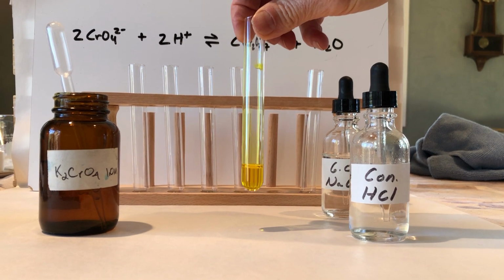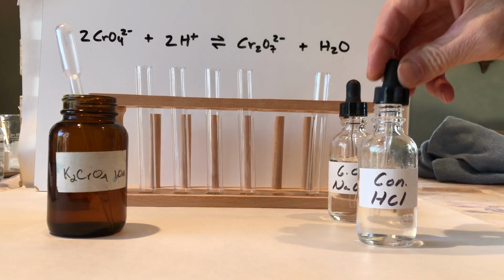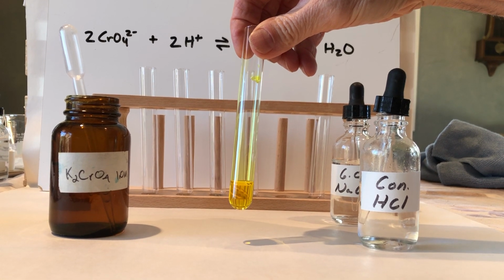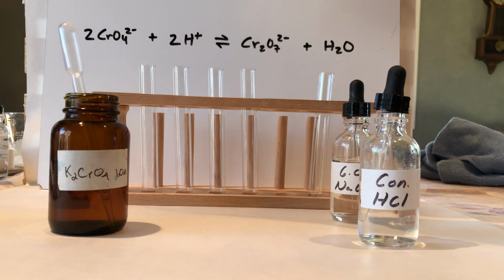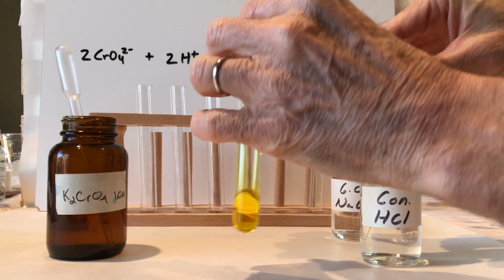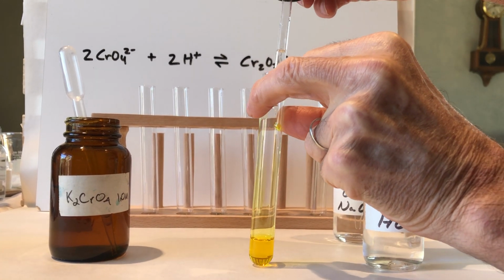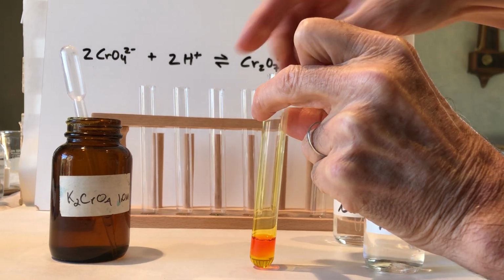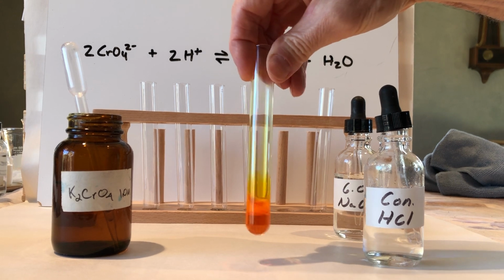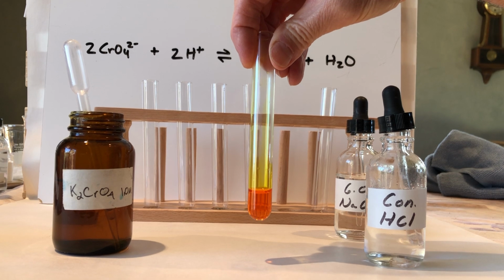And now we have a system in equilibrium, and we are going to add a stress to the equilibrium system, and our stress is going to be some concentrated hydrochloric acid, and the key thing is this is going to be the hydrogen ion. So you can probably predict what might happen, and we will also add and see what happens. So add a couple drops of the hydrochloric acid, so we've added some hydrogen ion to the system, and you should note the observations you get and what this means.